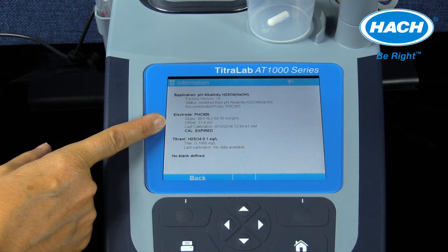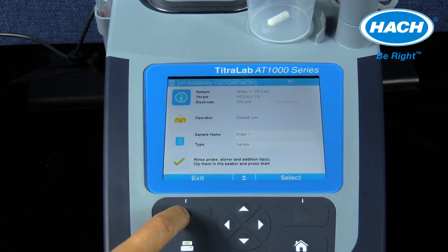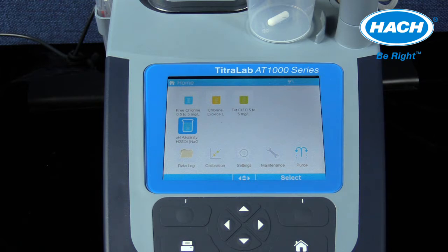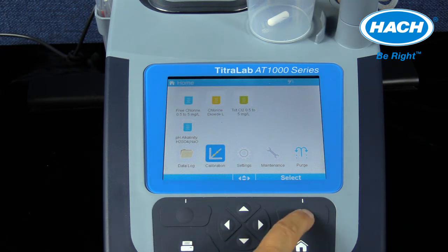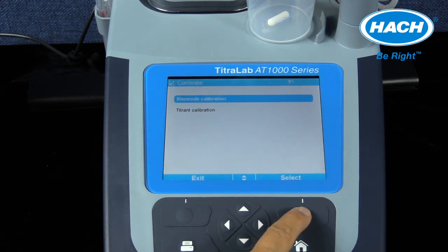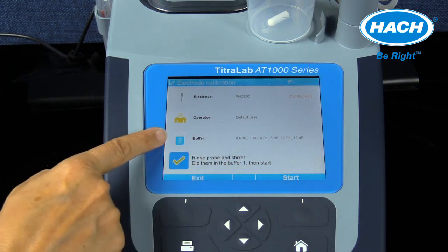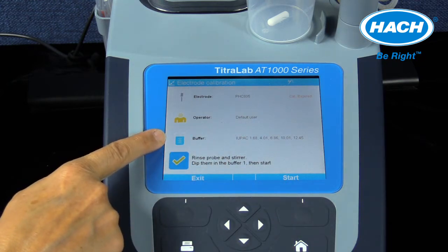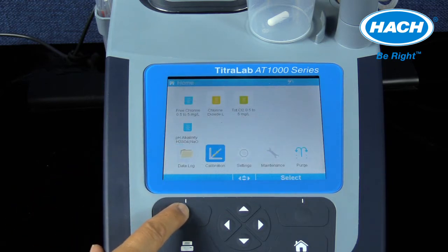To calibrate the electrode, it is necessary to exit out of the information screen by selecting back or using the home key. From the home screen, the calibration icon and then electrode calibration can be selected. The software will then advance to the electrode calibration screen. The software is going to display the steps to calibrate the pH electrode using IUPAC pH calibration buffer solutions that are automatically recognized. Other buffer sets can be used by using the settings icon from the main menu.